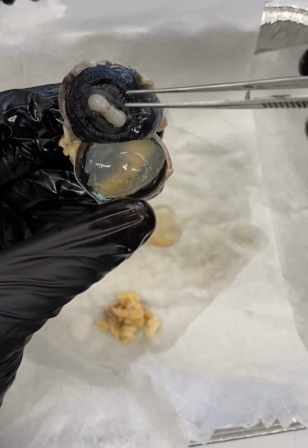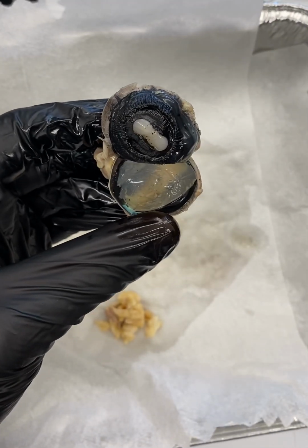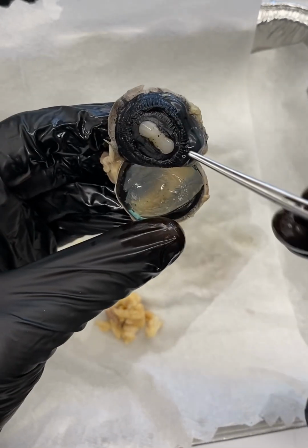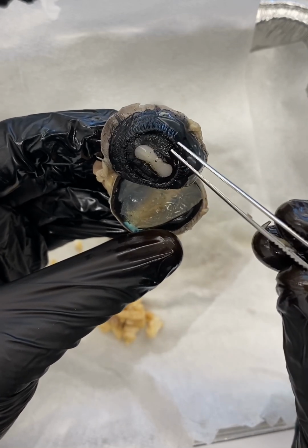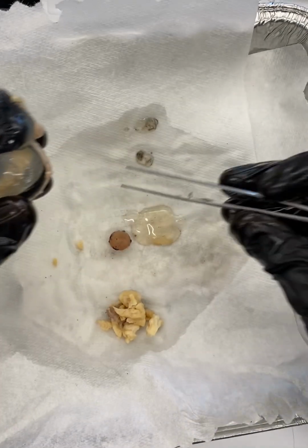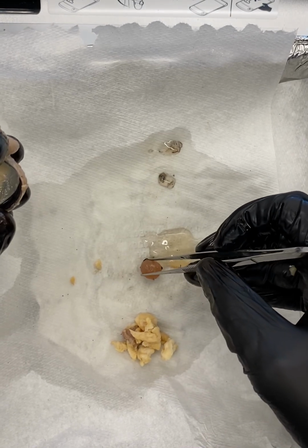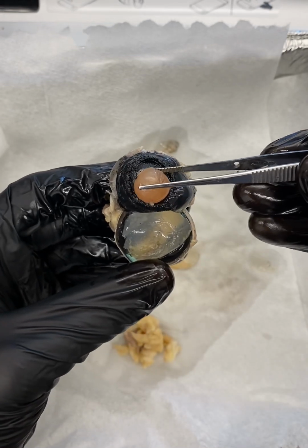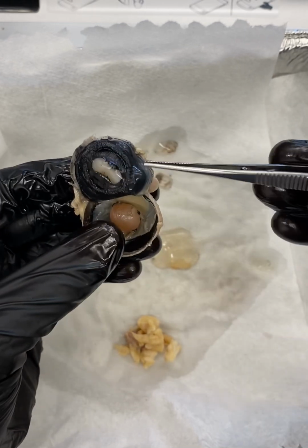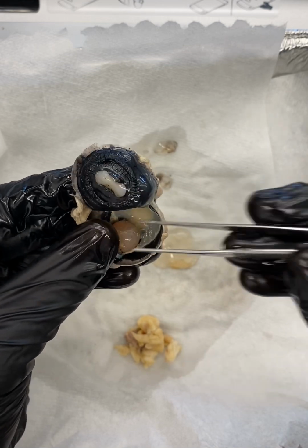Now, in this area, we're not going to be able to see them in detail, but we have something called zonular fibers, and sometimes they're called suspensory ligaments, right? But they would stretch out from these ciliary processes, and there's a muscle here called the ciliary muscle, and they would attach to our lens, okay? So our lens, if I can pick this up here, would be sitting in front like this, okay? And radiating from these ciliary processes over to the lens would be these suspensory ligaments or zonular fibers, right?